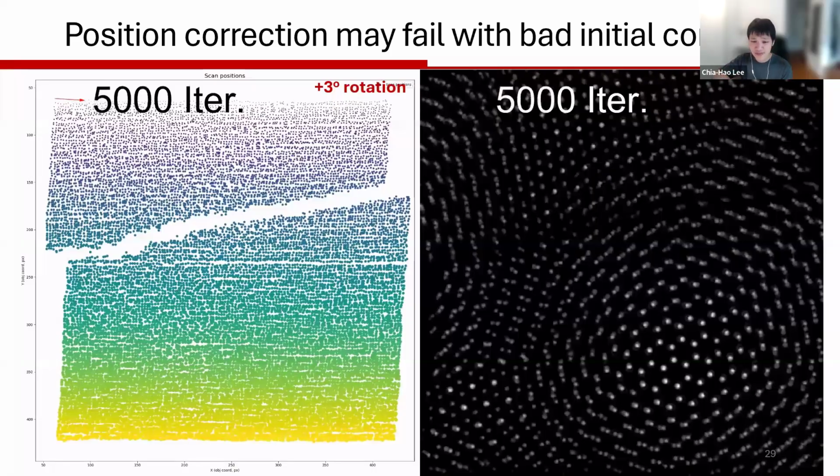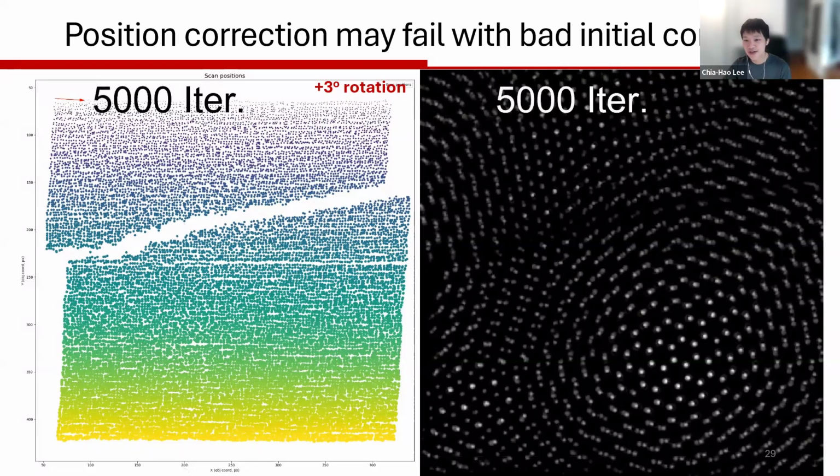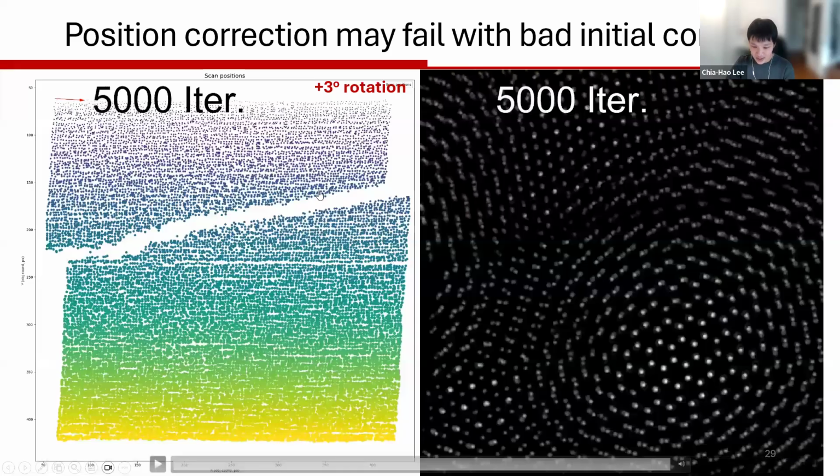So this is quite concerning because you see that most of the images are actually correct. The biggest problem here is that for the Ptychography reconstructed image, you don't have a single binary true-false value for whether this is correct or incorrect. The reconstructed image is partially correct, like this region seems to be fairly trustworthy, and also here. But here, you just created an artificial grain boundary of your crystal by having an incorrect initial position.